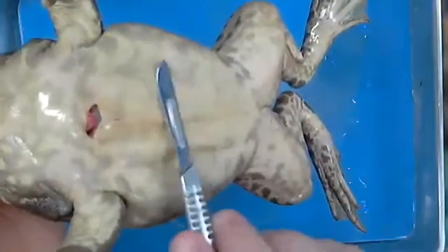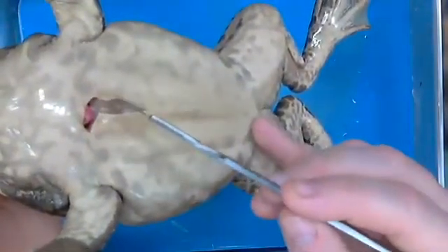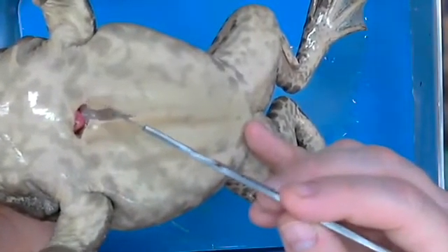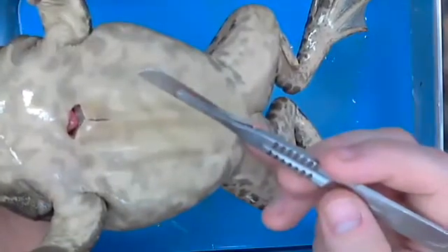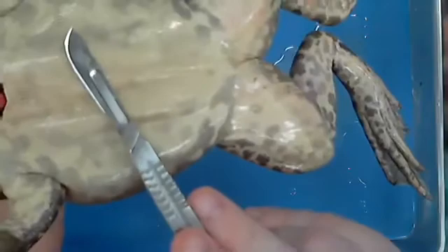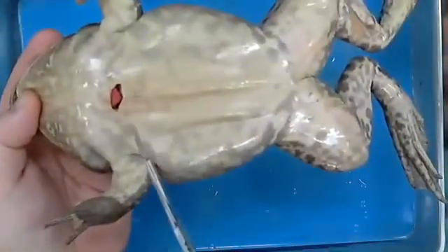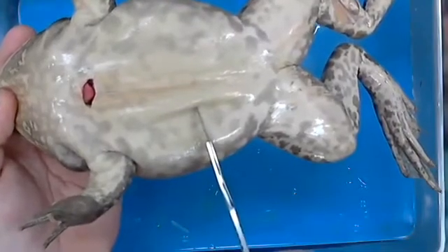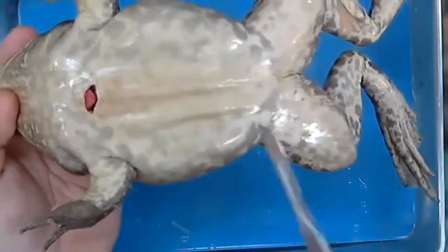This frog's pretty big. And so if he breathes oxygen in through his skin, what would that probably tell you about the size of his lungs? They're not big. Bigger than normal. So what we would expect to see in a frog like this, right, I'll come down, is probably lungs from maybe here to down in here. And we're not going to see that. You'll see that here in just 1 second.